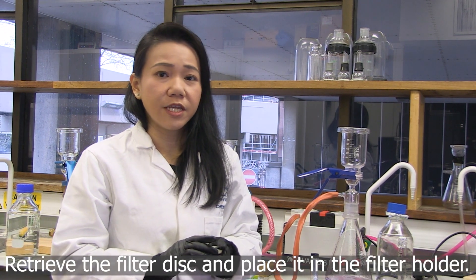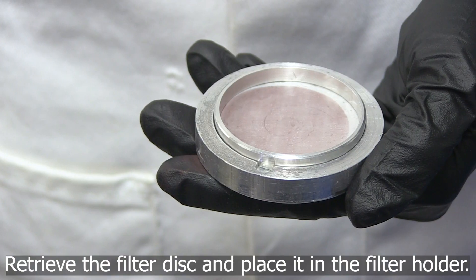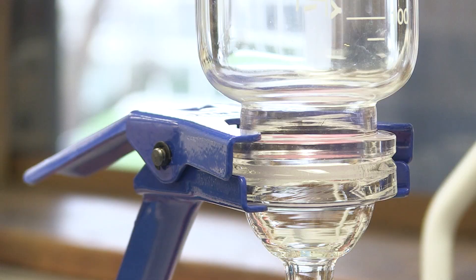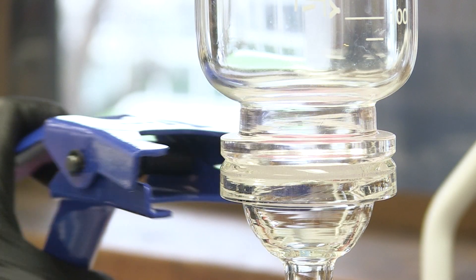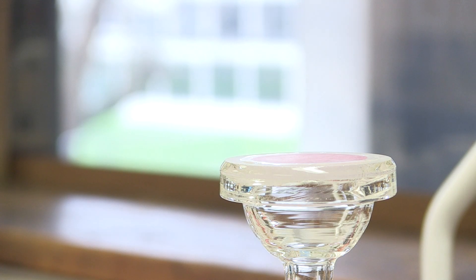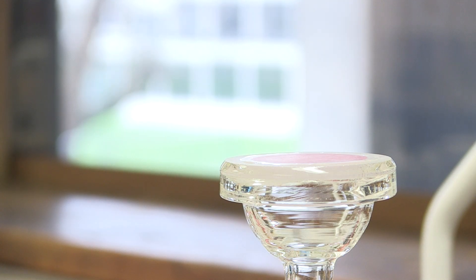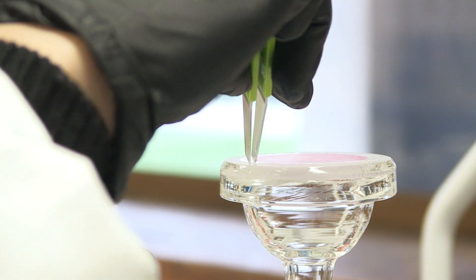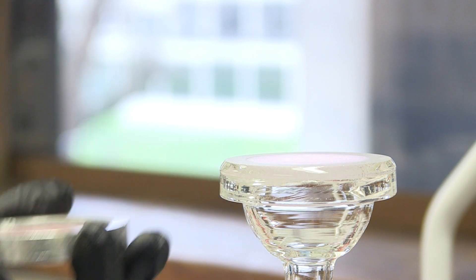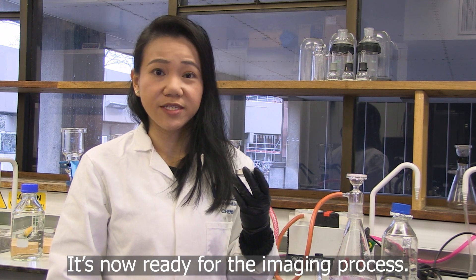Retrieve the filter disc and place it in the filter holder. It is now ready for the imaging process.